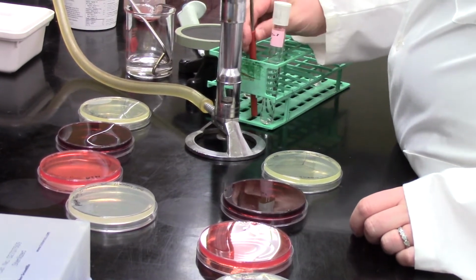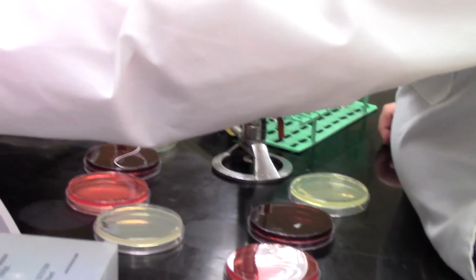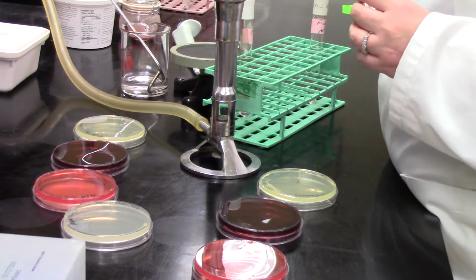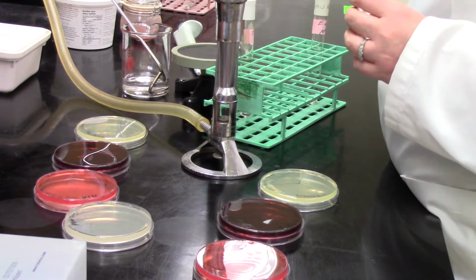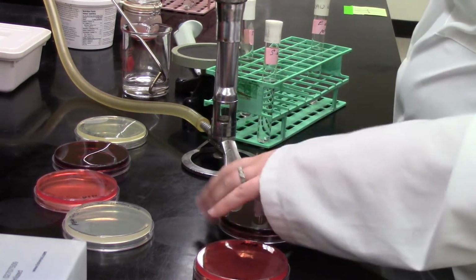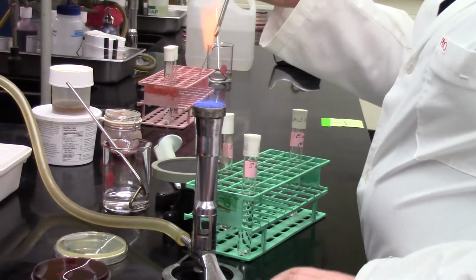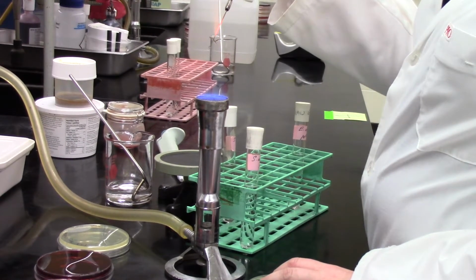This takes a little bit of time, like a lot of things in microbiology. There's a certain element to the lab work that's a bit repetitive, and this is certainly one of them, but we just have to work our way through all of these in order to get our known bacteria onto the plates. There's the EMB being inoculated, loop being sterilized.